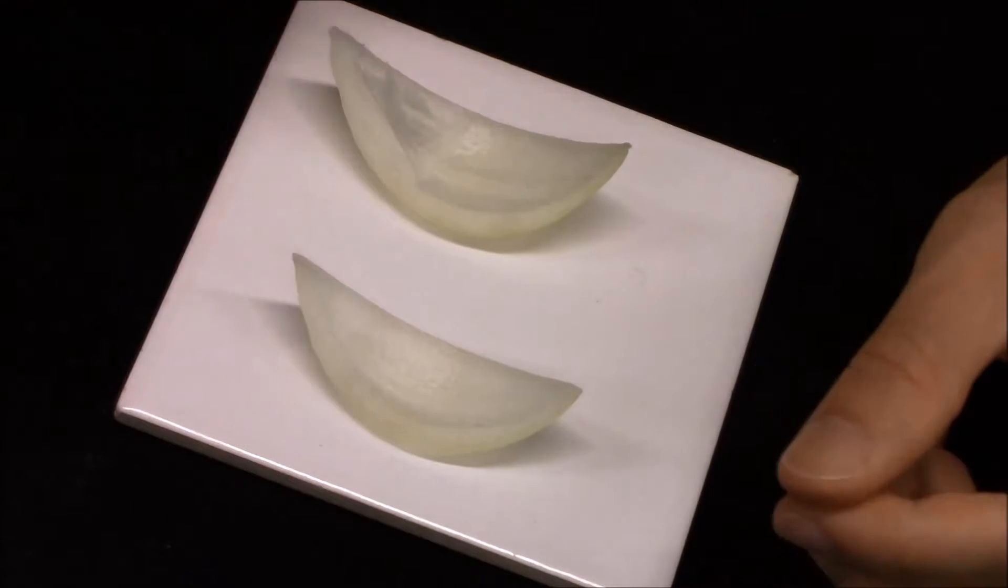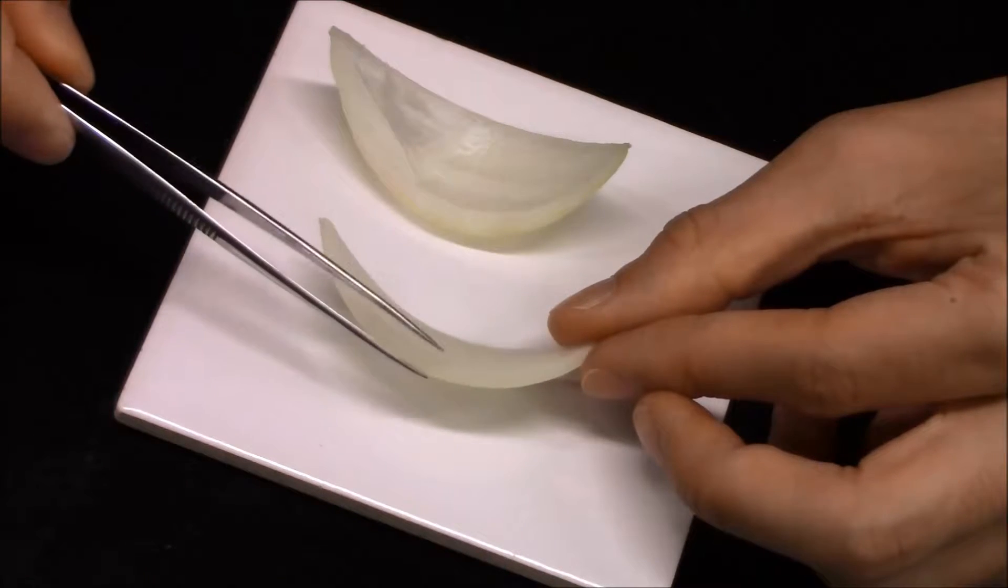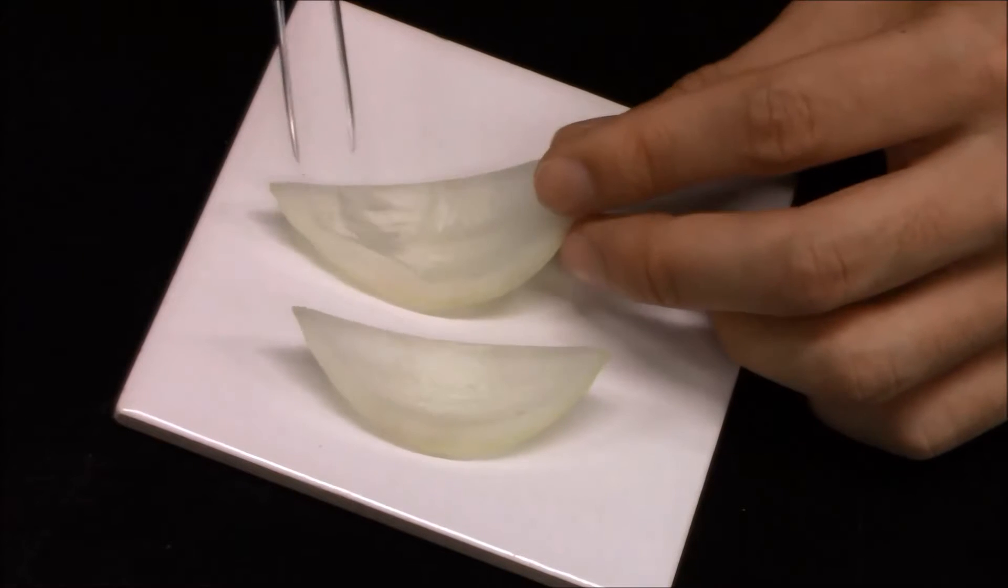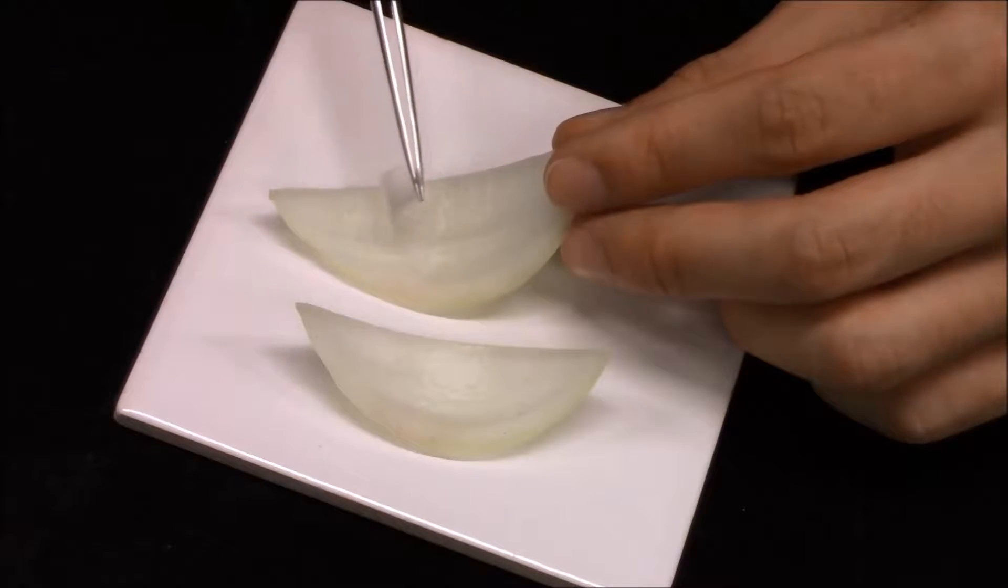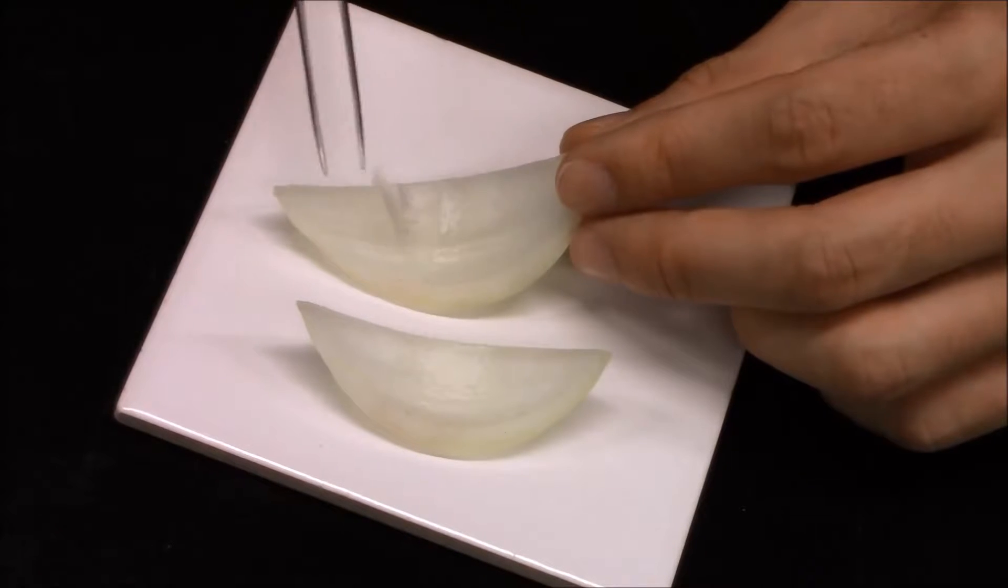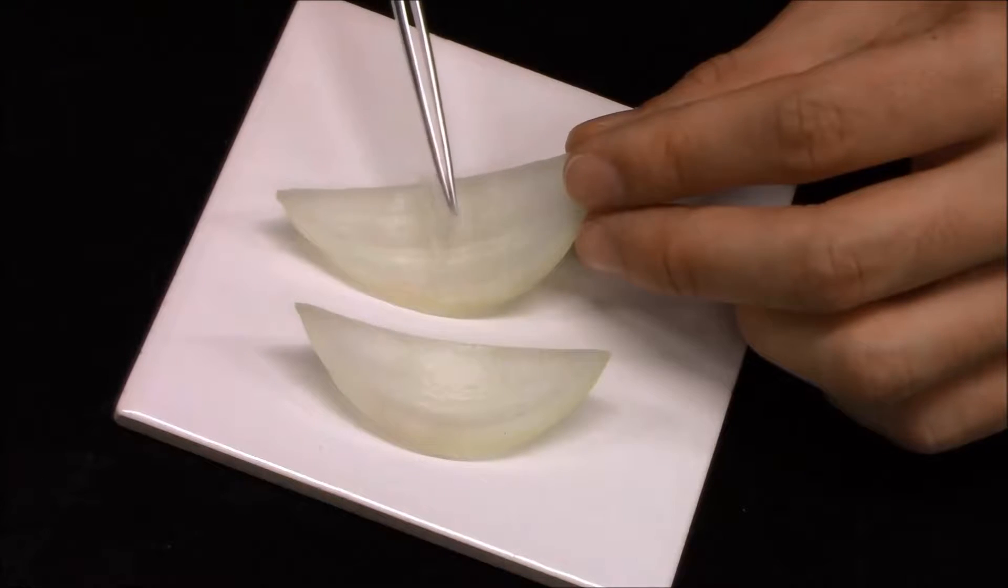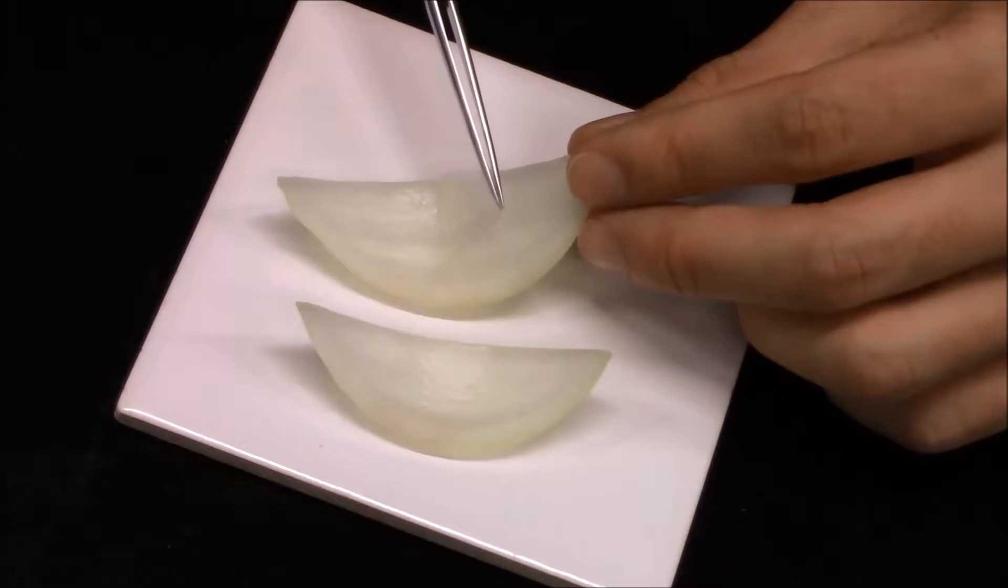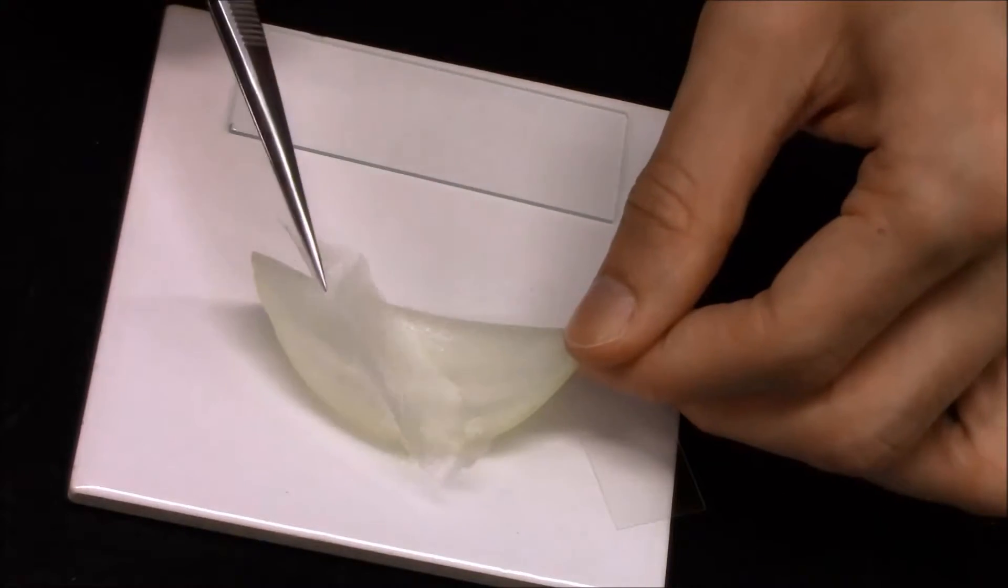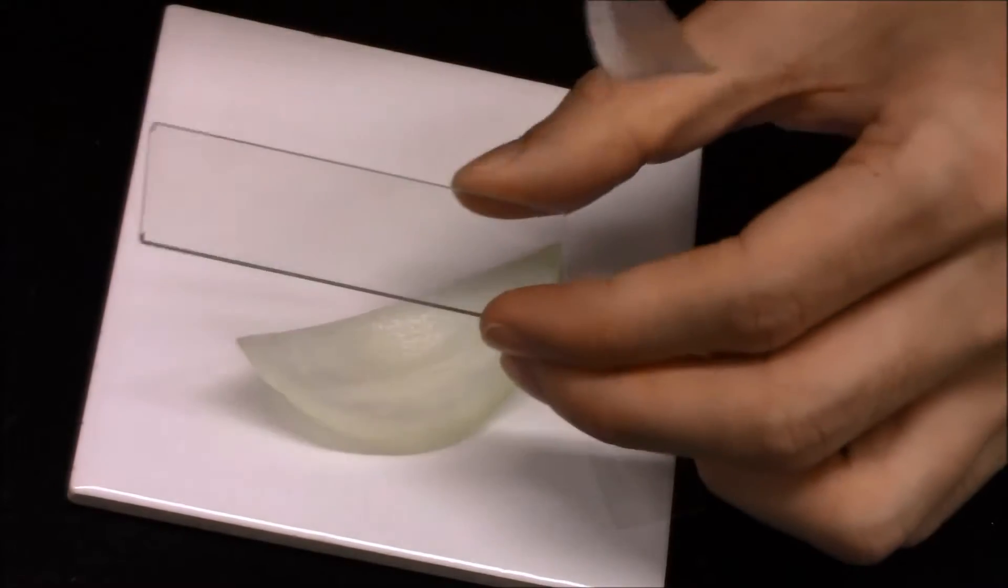So here, you see that there are two slices of onion. And remember that there is two layers for you to observe at this moment. So what you need to do is to tear a very thin layer of the onion epidermal cell. So probably what you need to do is just tear it, slowly peel it out, use the forceps, tear the epidermal cell slowly.